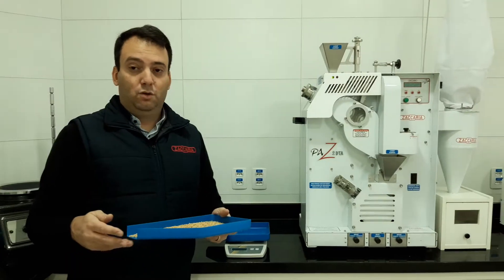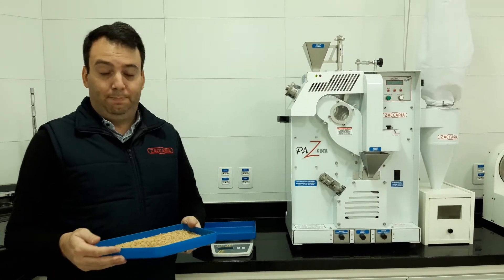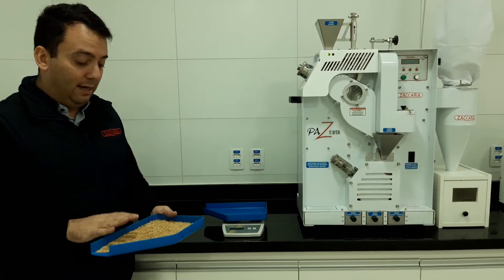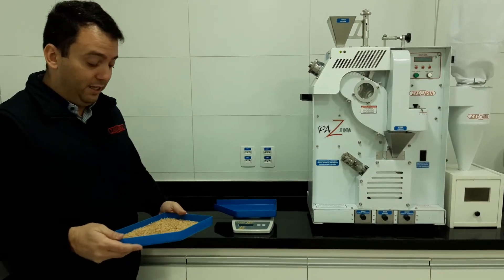After we have the sample, the paddy sample from the homogenizer, we need to measure 100 grams of this paddy.